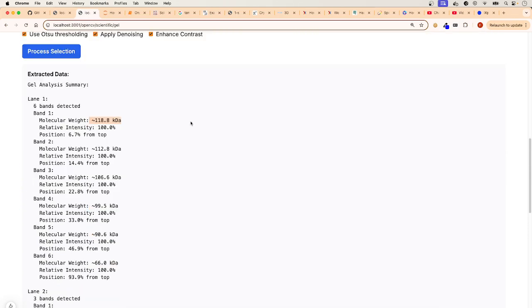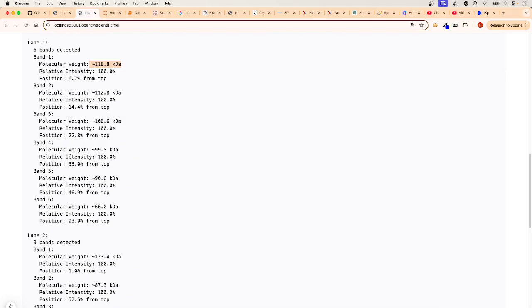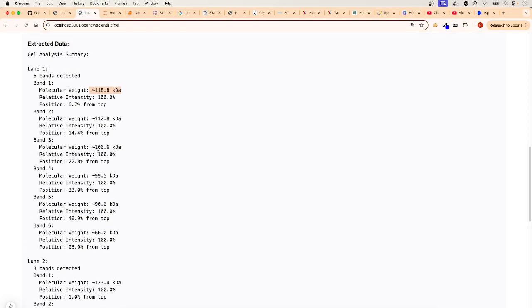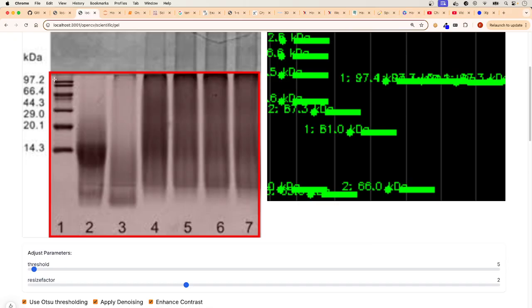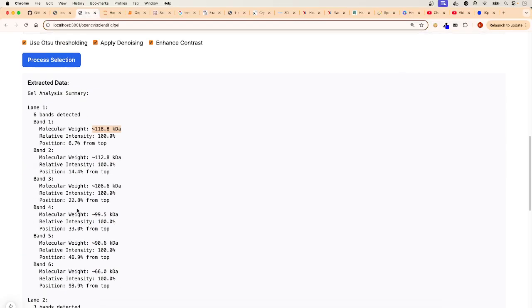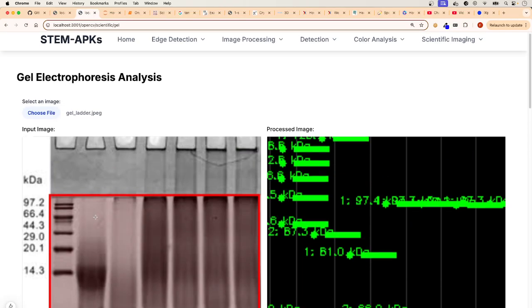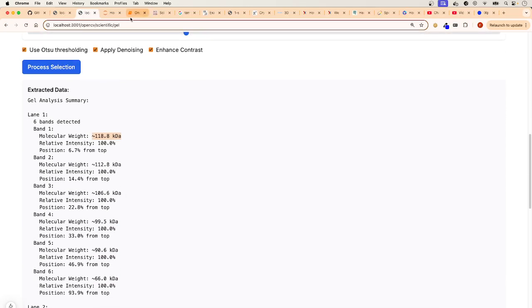Yeah. But it's not going to be exact until you make it work however you want it. These are just proof of concept. I did not play with these numbers. This is just to show you how it works. To make it work really well defined, you have to play with the numbers. But it doesn't do bad. I mean, it could be worse. So it chooses the ones for each one. For example, 66. Yeah, that's about lane two. I mean, it's not perfect, it needs to be optimized, but you can play with those numbers. So that's what's happening in that particular file.